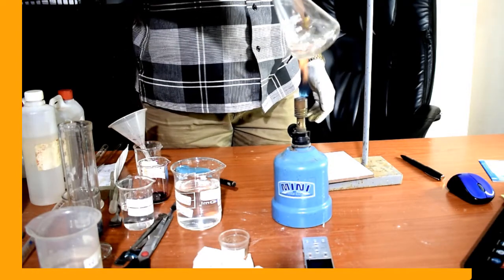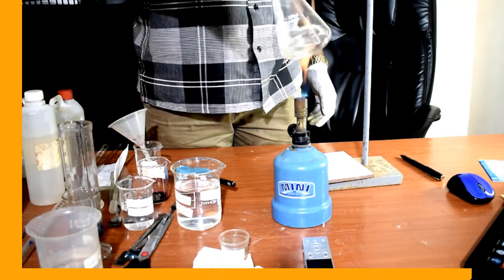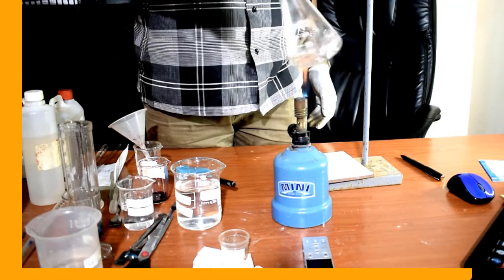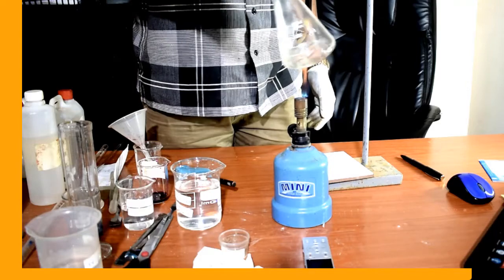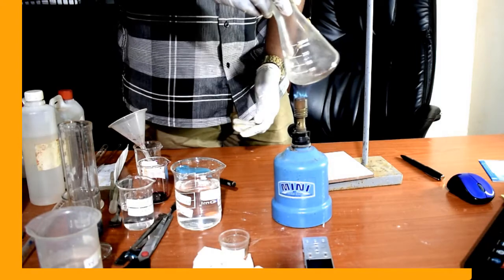You need around 70 degrees centigrade. That will be enough. But I don't need to measure the temperature. I can estimate. I don't need to reach the boiling point. That is enough.